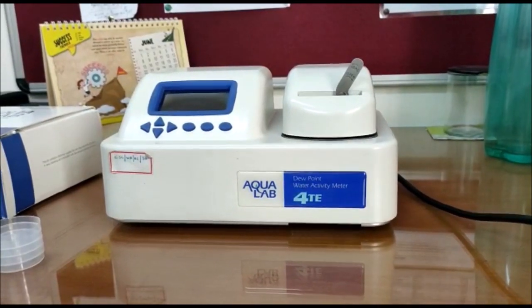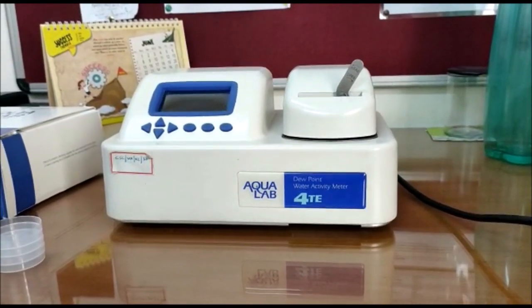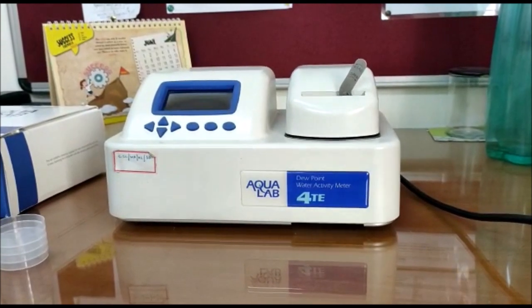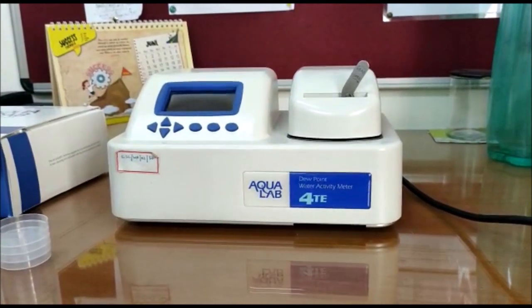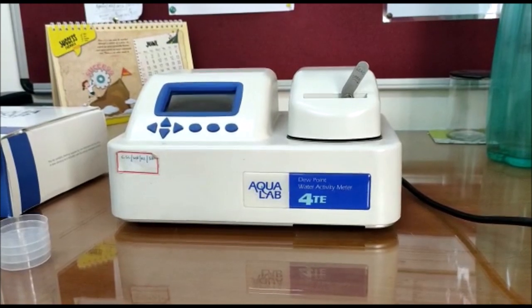Hello, this is Dipesh from SDS. Today I am going to demonstrate Aqualab 4TE water activity meter from Meter Group US.